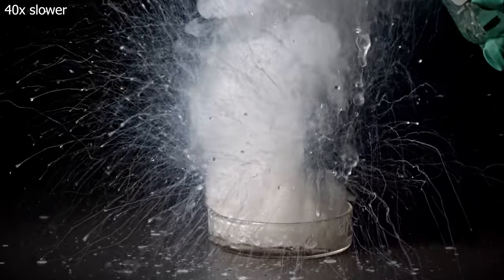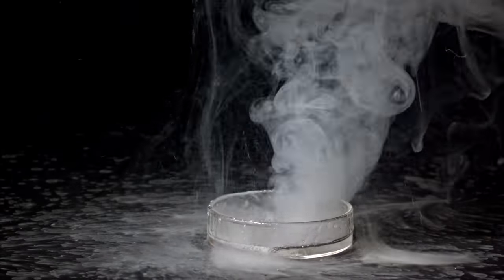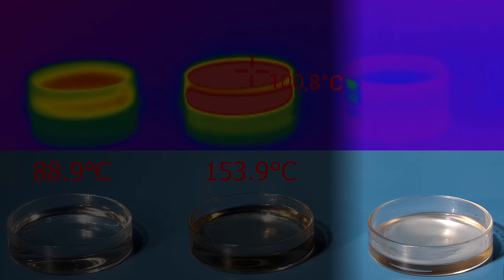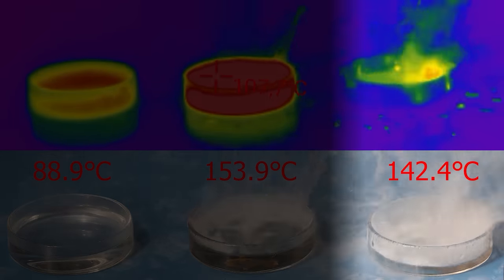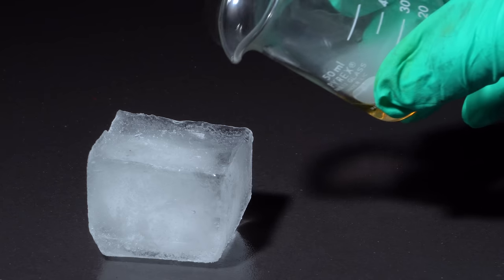Also, during hydrolysis a massive heat emission occurs. I showed you a hydrolysis reaction filmed with thermal camera in one of my previous videos. Therefore, if you pour this acid on ice, it will melt the ice quite intensively.